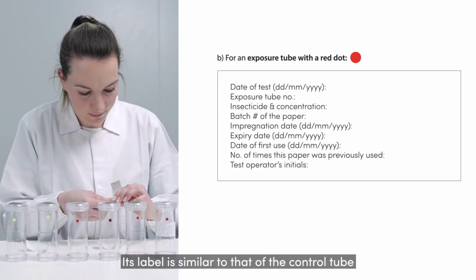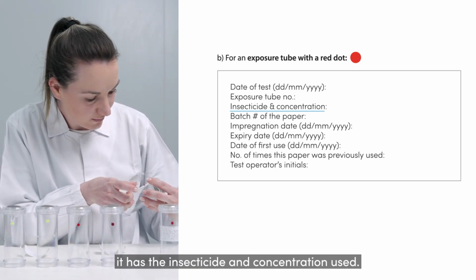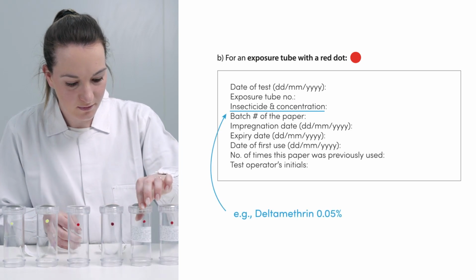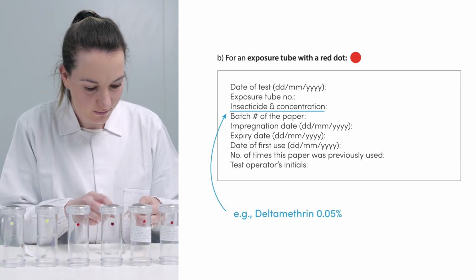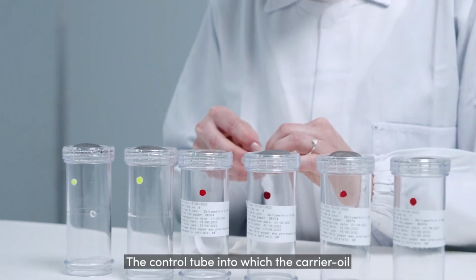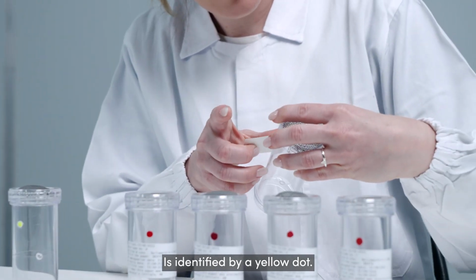The exposure tube, which holds the insecticide-treated paper, is identified by a red dot. Its label is similar to that of the control tube, but instead of having the type of control, it has the insecticide and concentration used. For example, deltamethrin 0.05%. The control tube, into which the carrier oil or acetone-impregnated paper is inserted, is identified by a yellow dot.